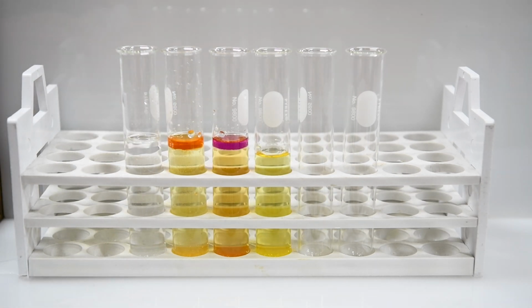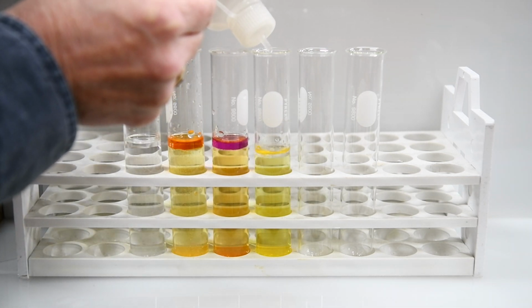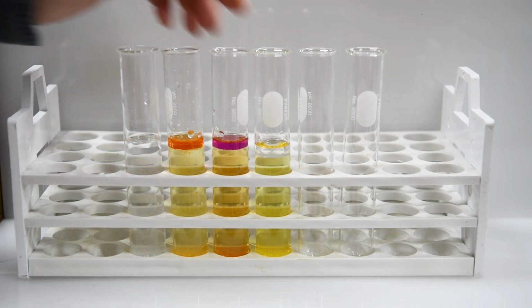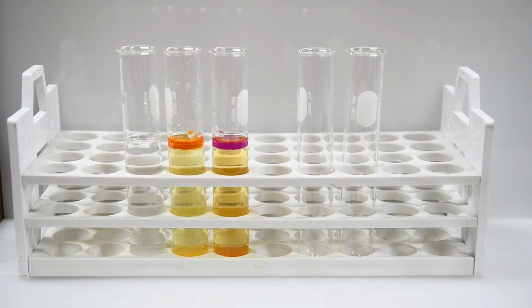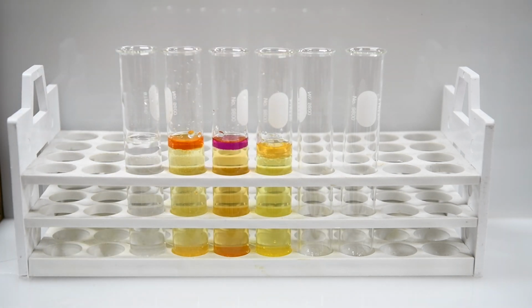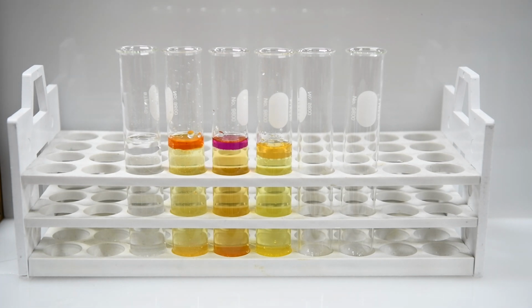So let's add some hexane to the top of this so we can better see that orange color, because if it's orange, it ought to be bromine, of course. So I'm going to take the test tube out for just a moment and get it all nicely mixed up so you can see what the bromine looks like. And as you can see, we've got a nice orange layer on the top. So that color change tells us a reaction did occur, and apparently the reaction produced bromine because we've got basically the same color that we got with the pure bromine earlier.